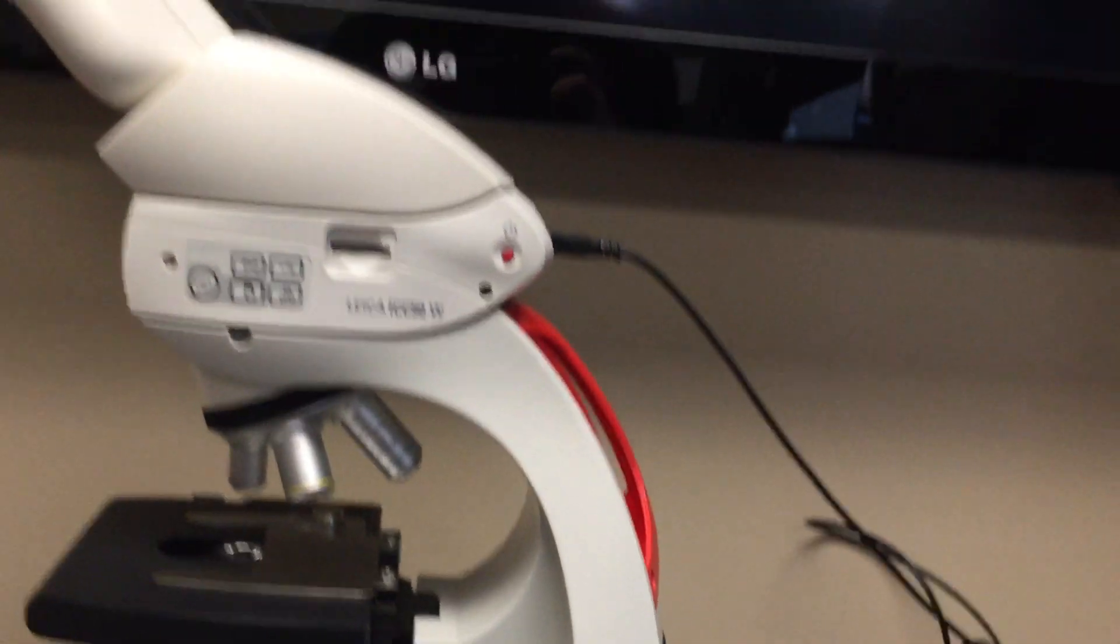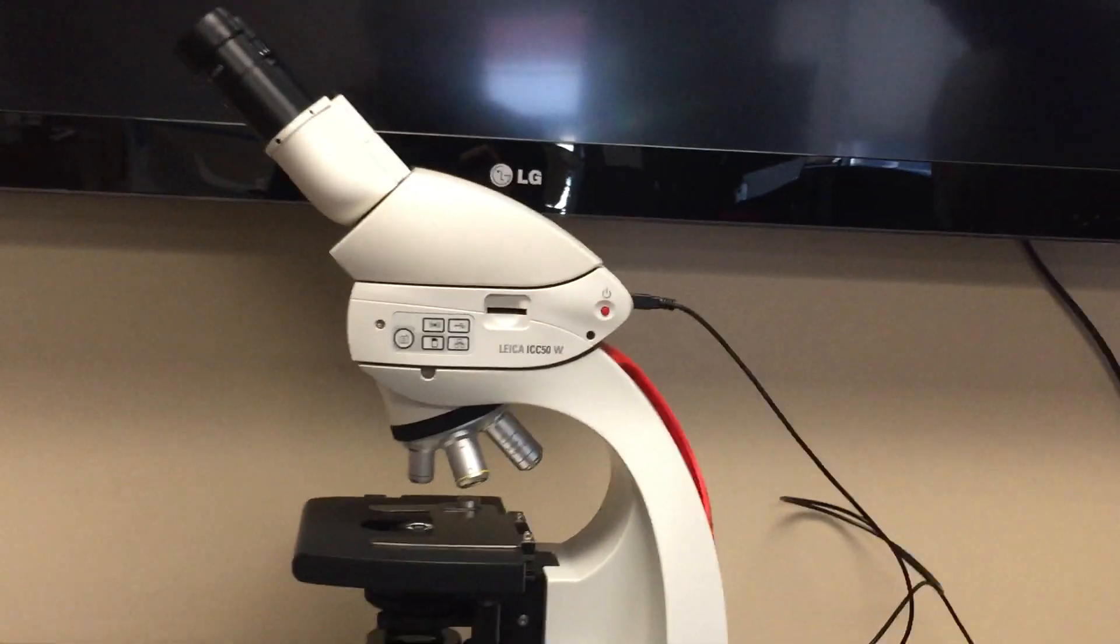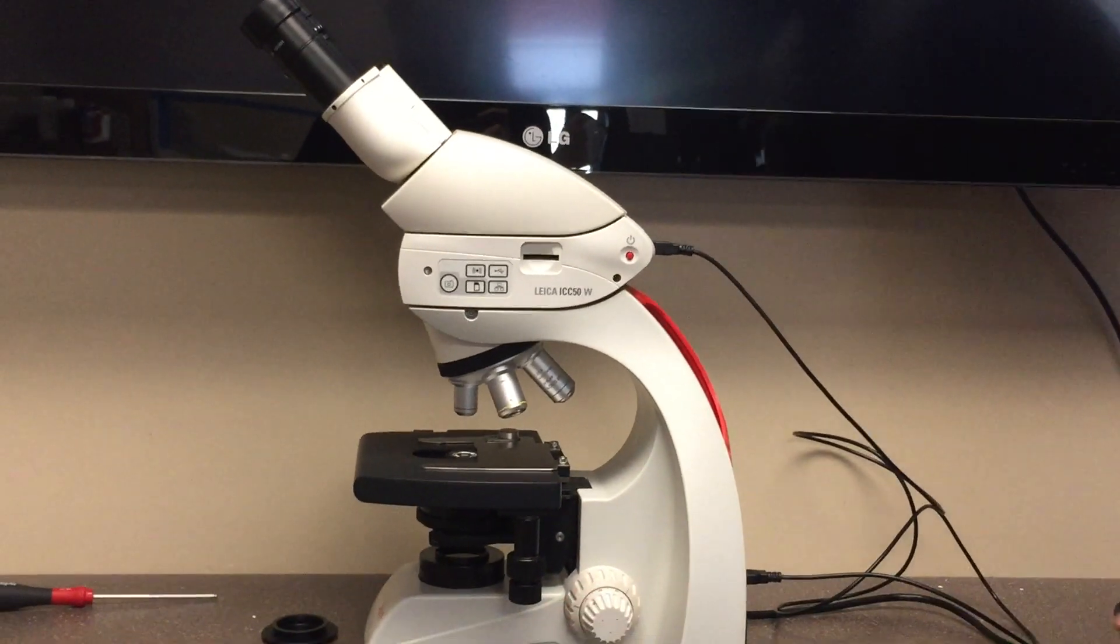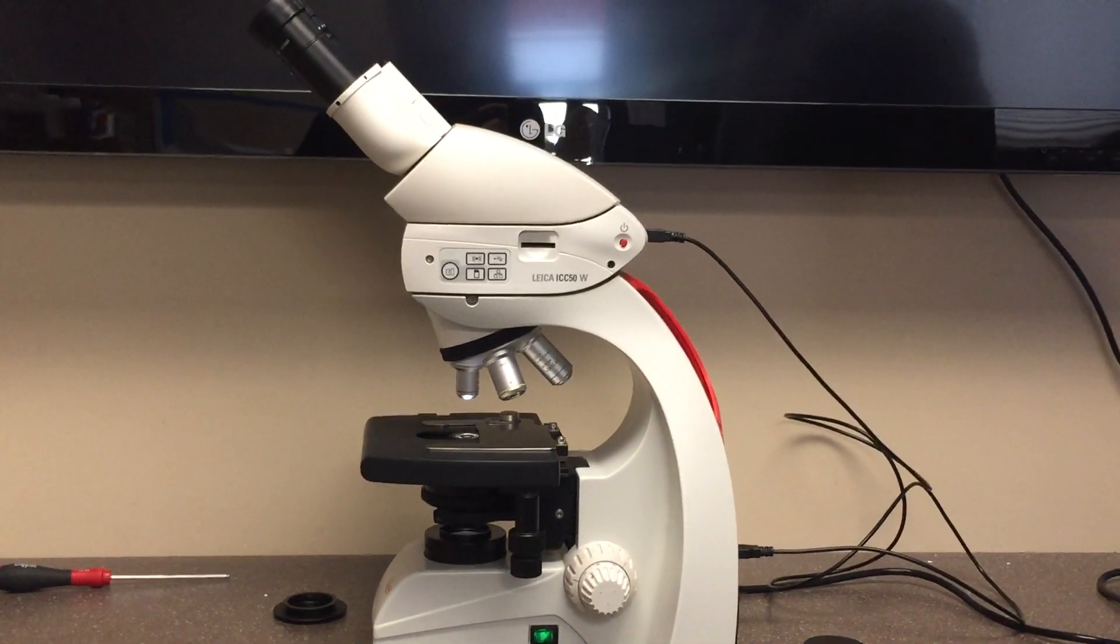Once those cords are inserted, with the microscope plugged in, simply power on the scope, power on the camera, and you're good to go.